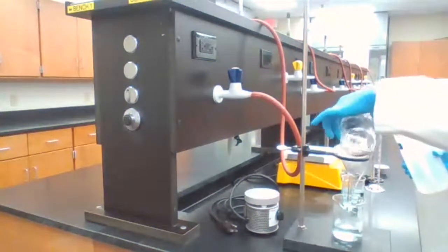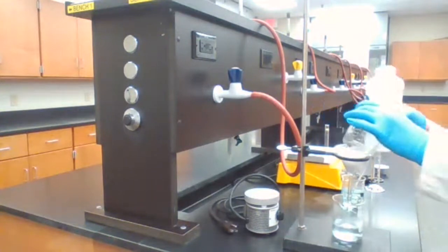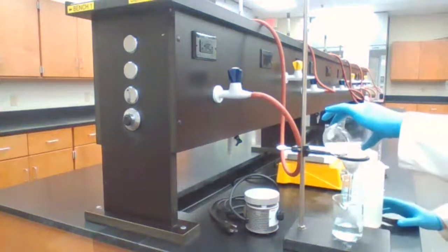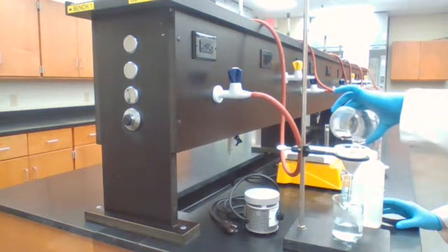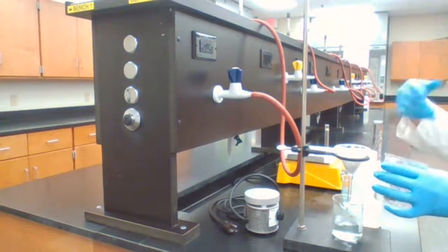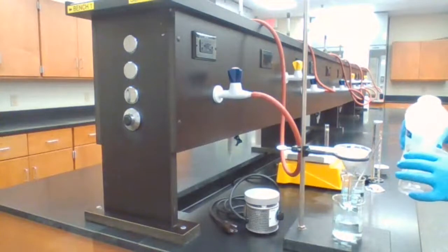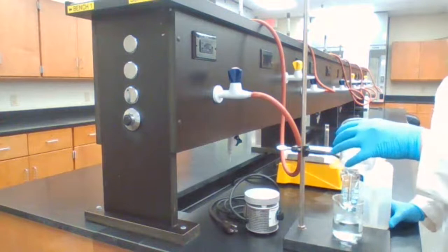If you could please look at the procedure, or if you remember from reading the procedure, give me the next steps while I'm doing the filtration. So it's just simply transferring the solid using some extra water, which serves two purposes. One, it transfers all the copper in. Second, it washes the copper. So basically, I'm done with washing with water. Just give me the next steps after washing with water, please.